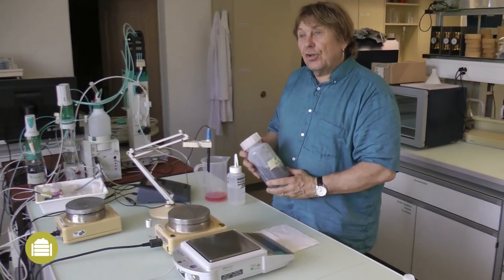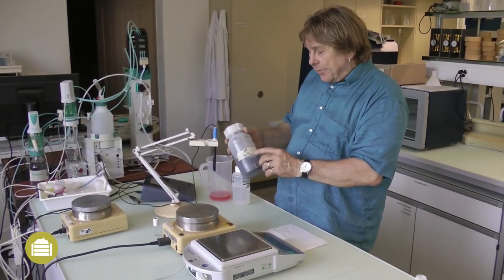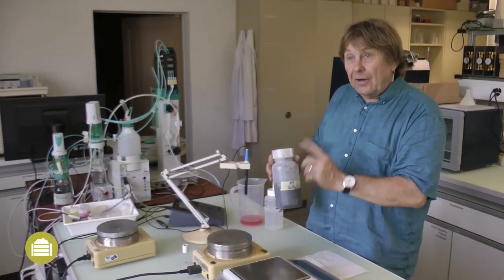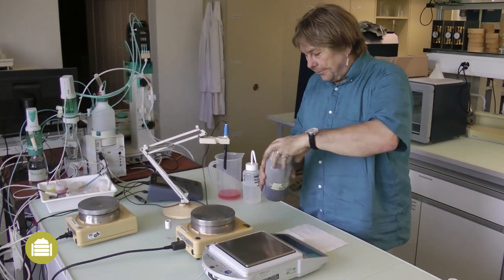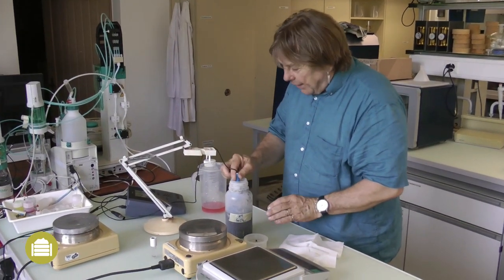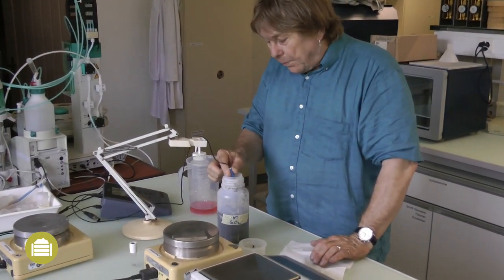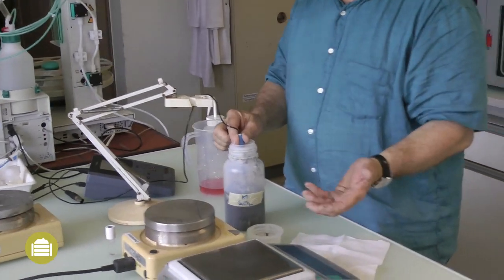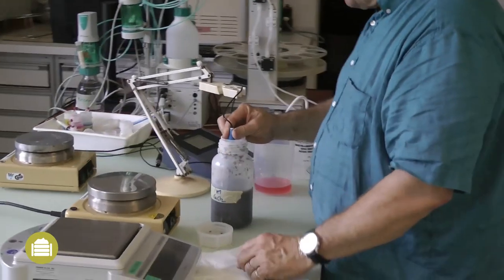The pH value of the compost is measured in the calcium chloride extract before its filtration. In general, the pH value of a fresh compost varies between 8 and 8.5, and of a ripe compost it is lower.